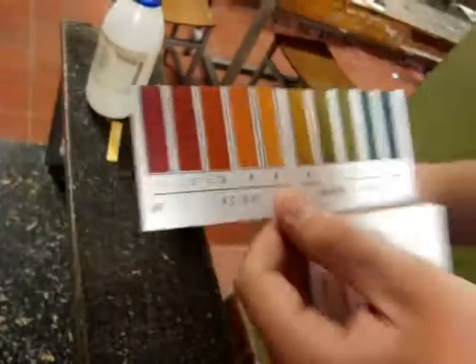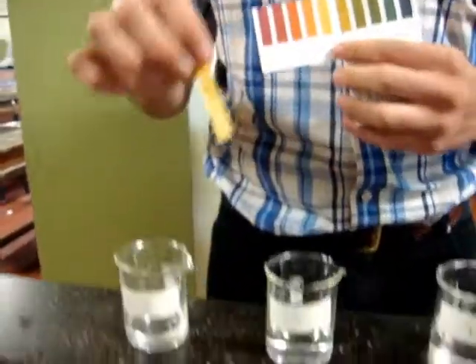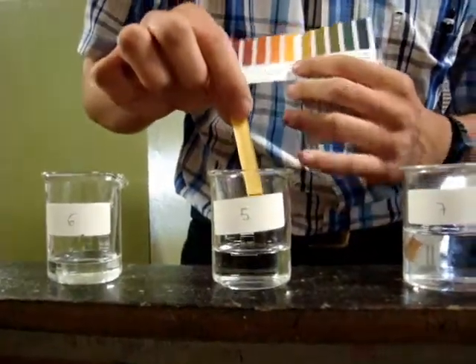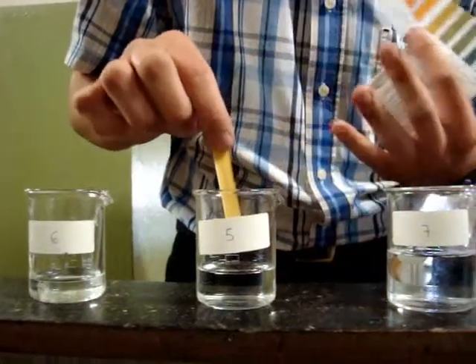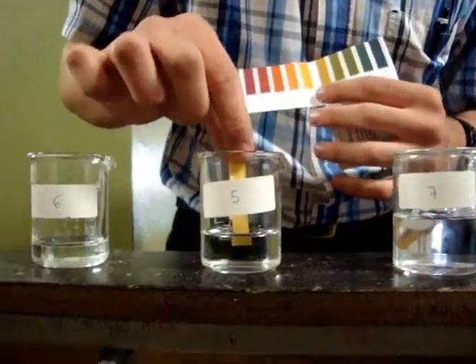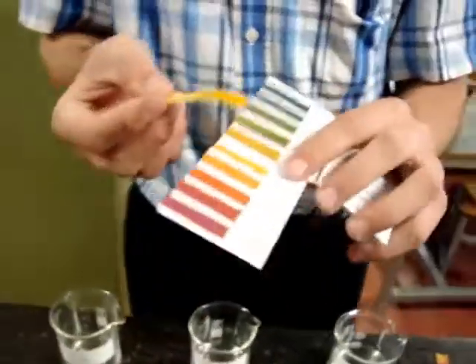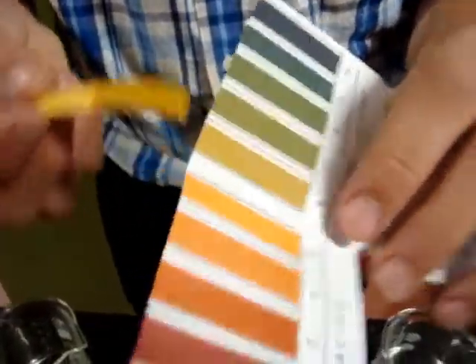Now we are going to insert this stripe in water. It should have pH 7 because it is neither acid nor basic. And it shows a color between 6 and 7.